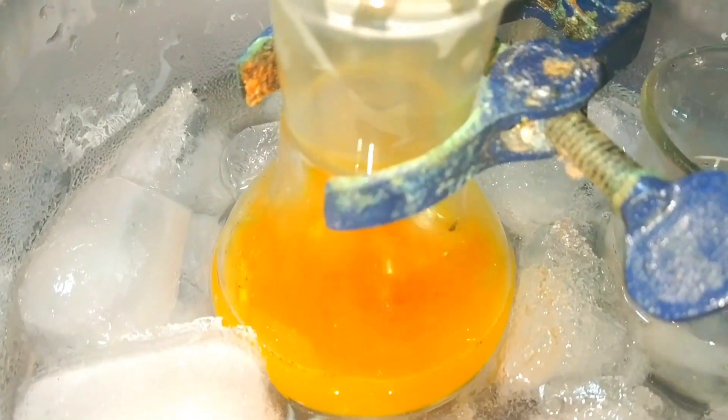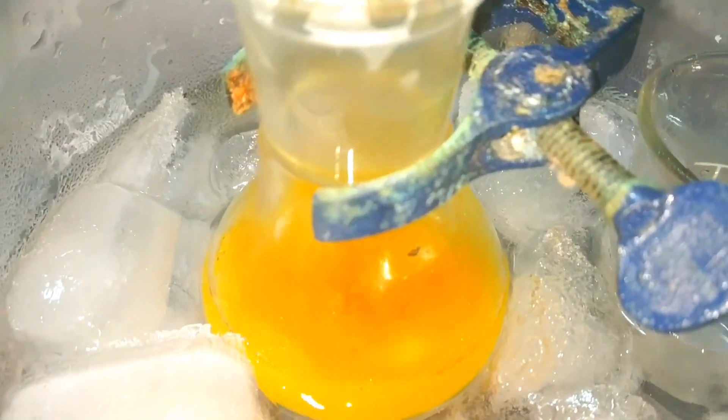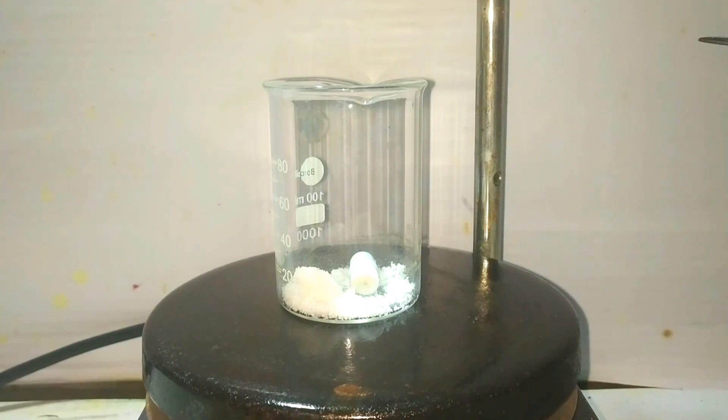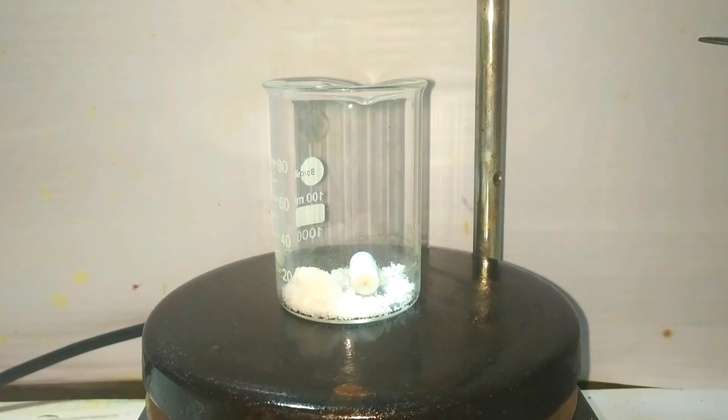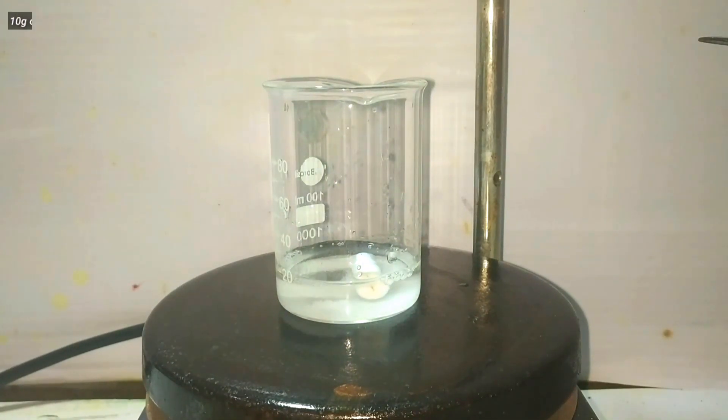Continue adding the sodium nitrite solution very slowly, drop by drop. While the addition is ongoing, prepare a solution of potassium iodide by dissolving 10 grams of potassium iodide in 25 milliliters of distilled water using a magnetic stirrer.